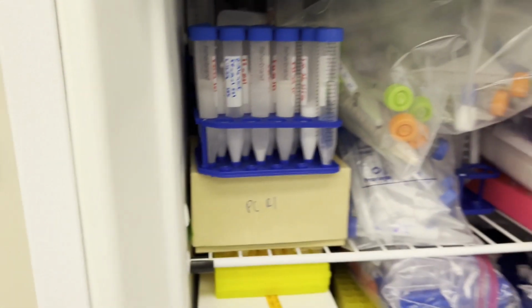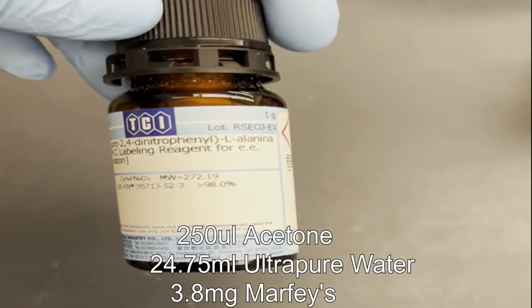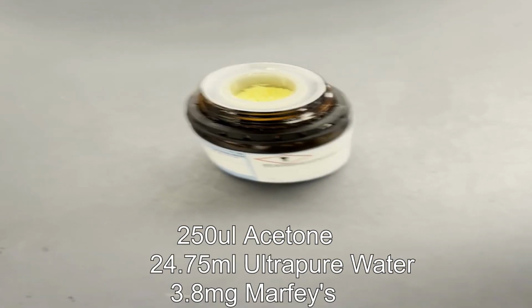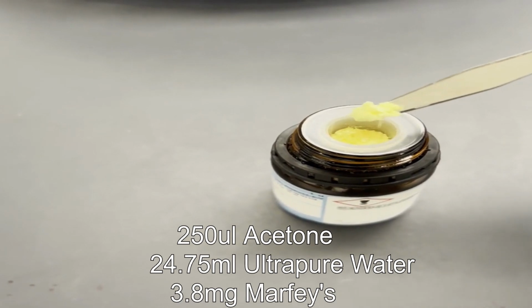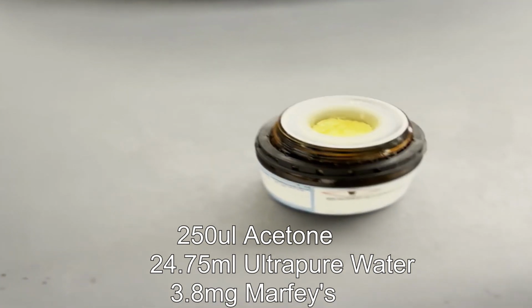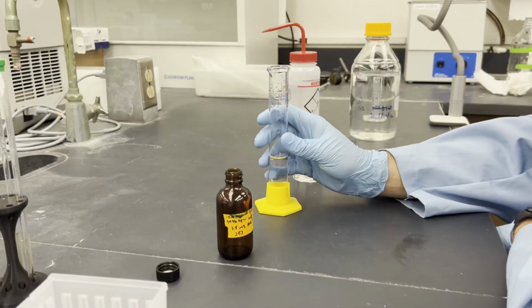These standards can be frozen until needed as well. Our HPLC labeling reagent Marfey's will need to be dissolved into solution, so we will be using 99% water and 1% acetone. It can give issues with dissolving, so the acetone can be increased up to 10% to ensure it fully dissolves. We will begin by adding the water to our glass bottle.